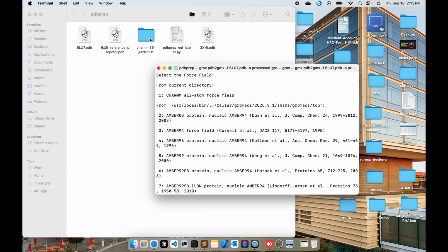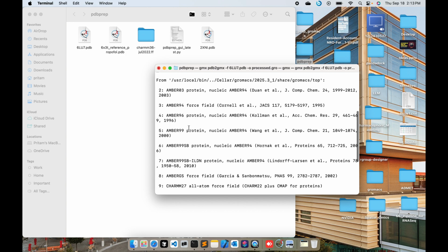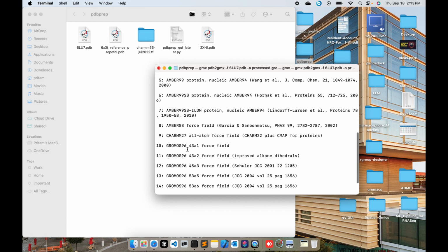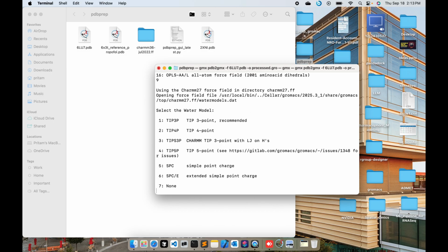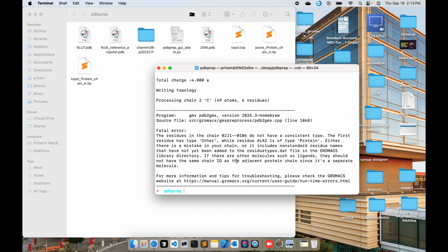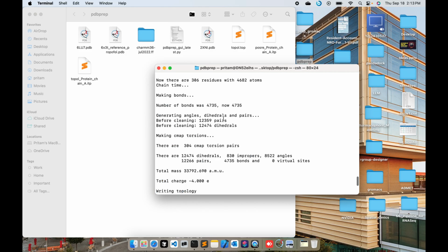So since I put here the CHARMM36 July 2022 force field, it will show in your current directory. And also you have other force fields like AMBER03 and then CHARMM27, GROMOS96, etc. Okay, and then if you type in, for instance, I am selecting CHARMM27, number 9. Okay, and then you type in 1, and you can see that you have these kinds of errors. And these errors are generally what you encounter during this kind of operation, right?